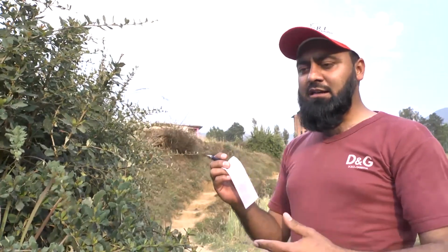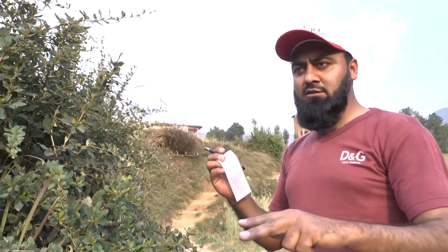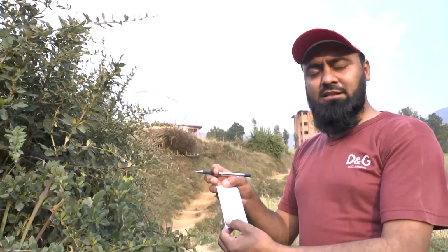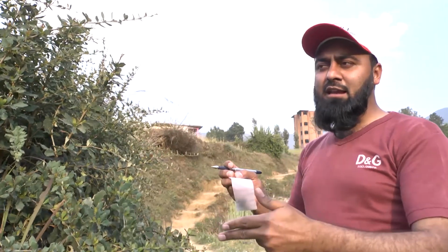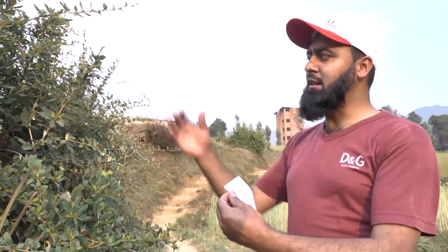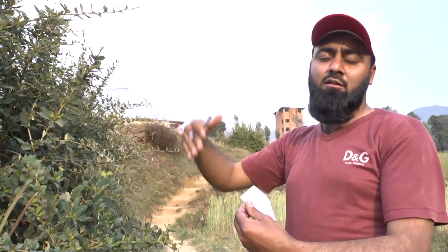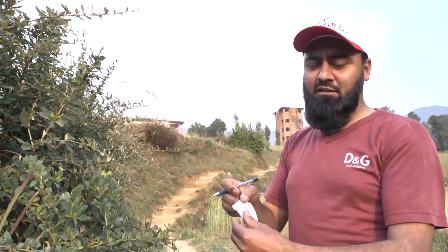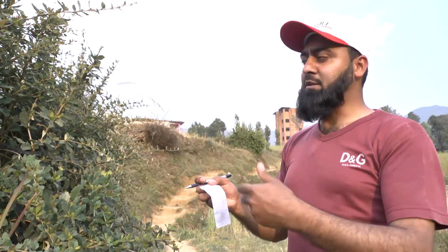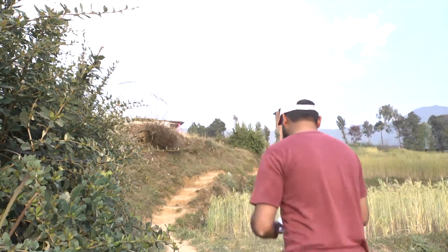In the biological test, they have a panel of grasses and wheat susceptible lines on which they will inoculate the aecia from these samples, and with that we can see if it is going on wheat or any other grasses, and that will then tell us that this barberry plant was infected by which rust and which forma specialis of that rust: Puccinia graminis tritici, Puccinia striiformis tritici, or Puccinia striiformis forma specialis poae. This is the one step.